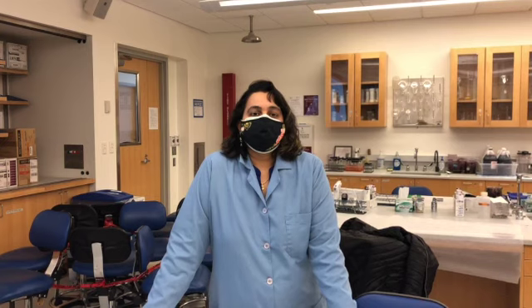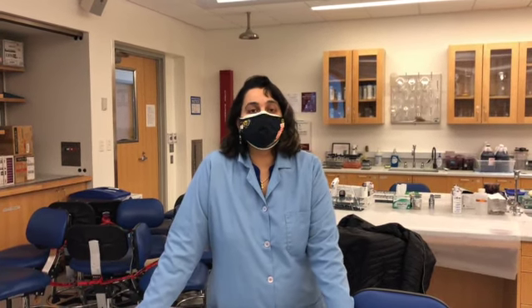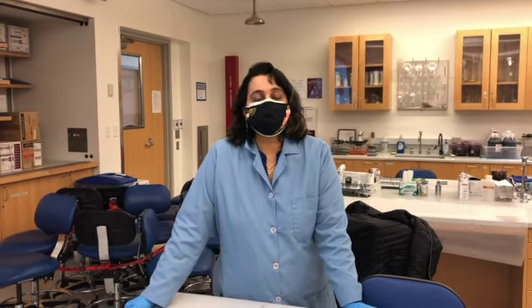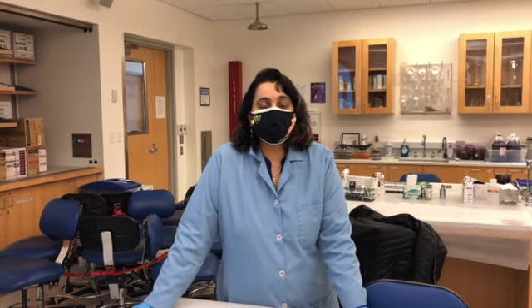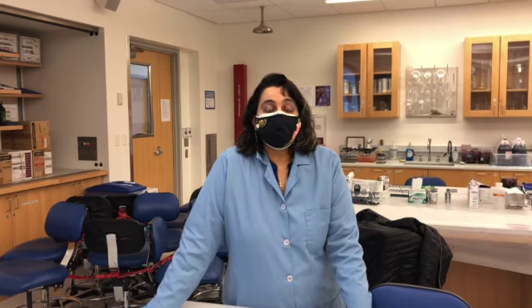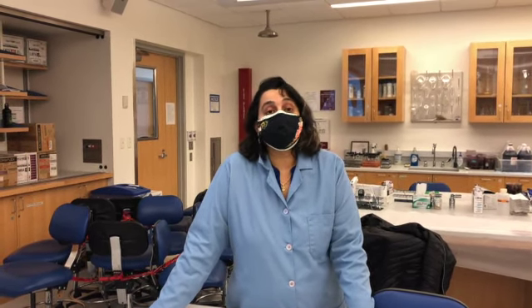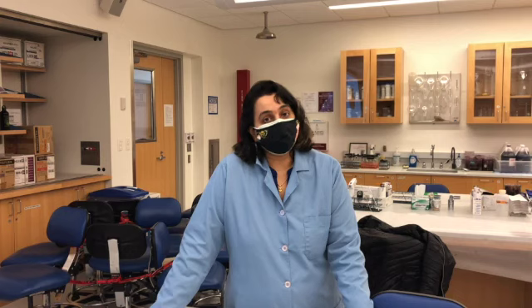Hey guys, so this lab is about gram-positive diagnostic tests. The reason we are learning this is, you have a patient with a bacterial infection, you did the streaking, you separated the bacteria as single colonies, you did the gram staining, and when you saw a lot of gram-positive cells, your next step is to identify the bacteria. That's the reason lab 3 is all about gram-positive diagnostic tests.